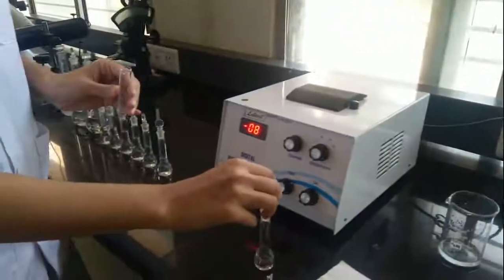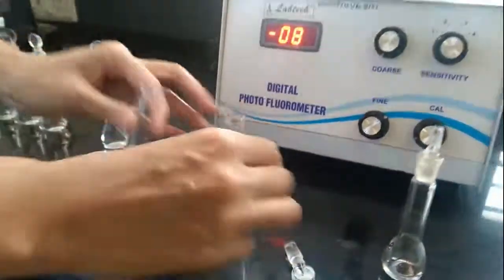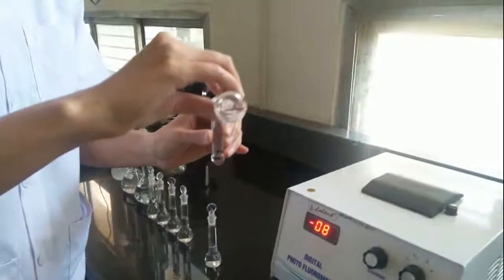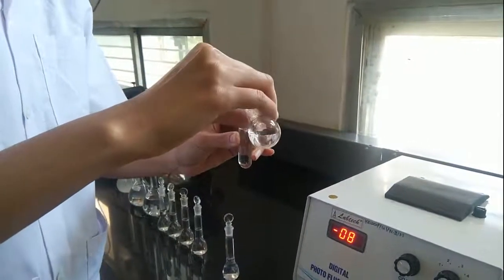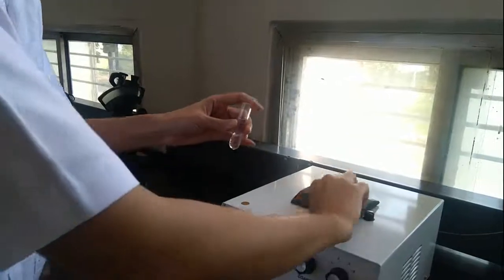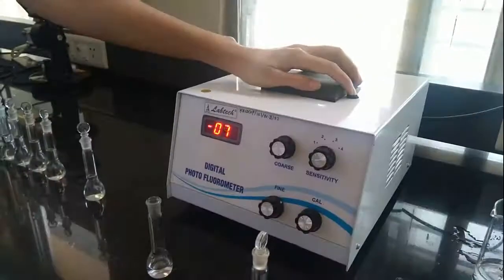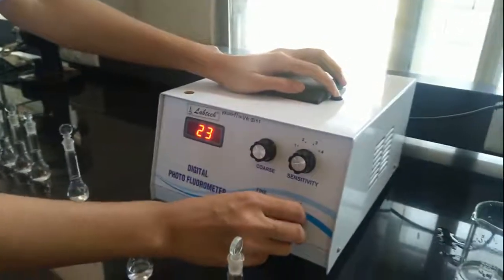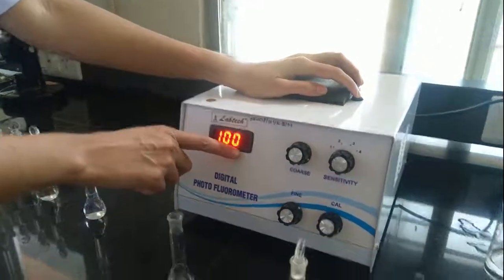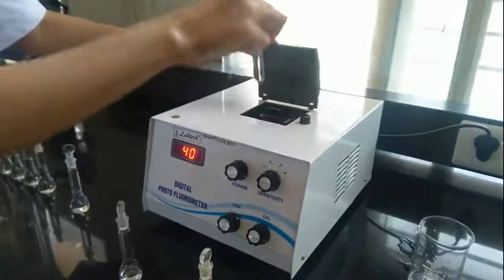Now we are going to set 100 with the highest concentration, which is 2.5 micrograms per ml. There is no need to rinse because we used H2SO4 earlier. We can fill the cuvette up to 70%. Now we adjust 100. You can see we have adjusted 100 with the highest concentration. Now we are going to take the reading of the first standard solution.